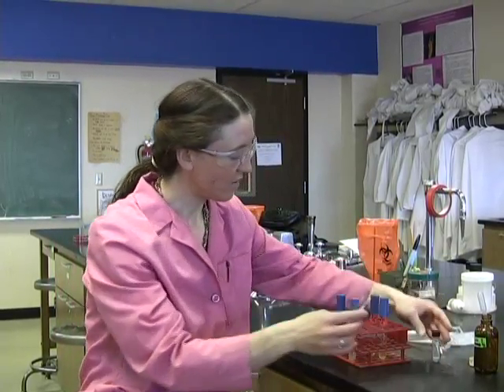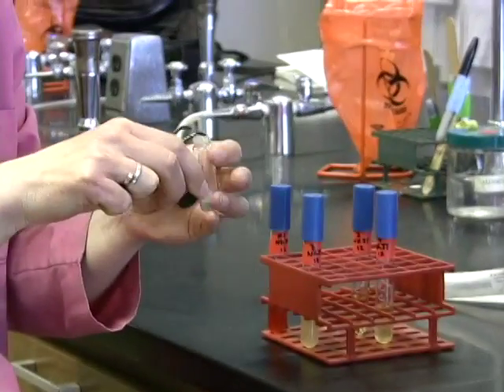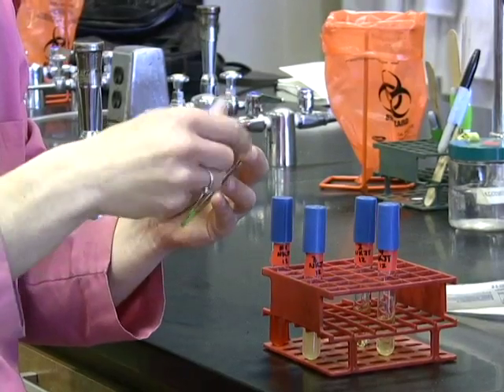So what this means is one of two things. It might mean that the organism has not reduced the nitrate at all, hasn't converted it to nitrite, and it lacks the enzyme nitratase, meaning that it's negative. But on the other hand, it may have taken the nitrate to nitrite and then kept on reducing it all the way to other nitrogenous compounds. In order to find that out, we're going to add a metal, zinc, to cause the reduction to occur and see whether it's negative or whether it's positive by having taken it to other nitrogenous compounds. So I'm just going to add a little bit of zinc.